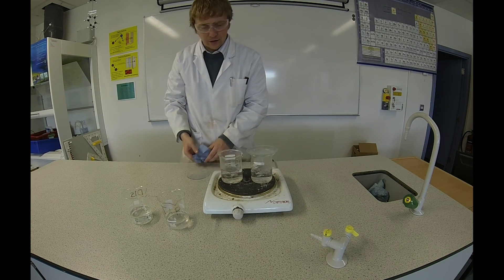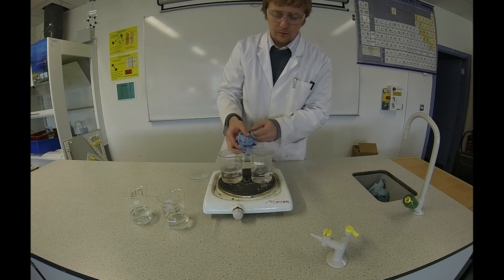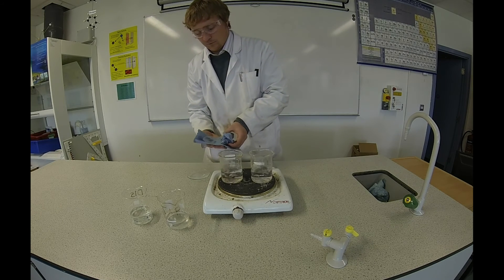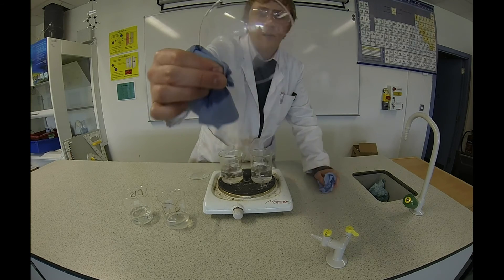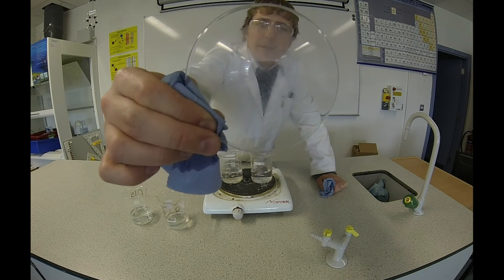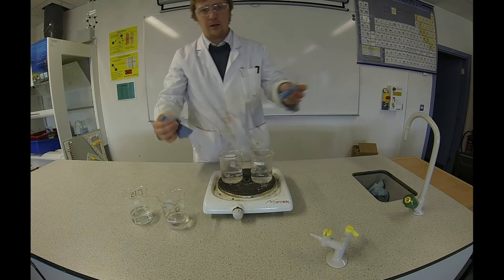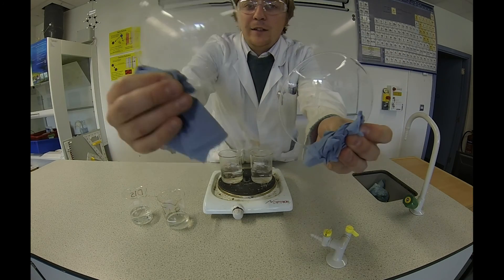Now we can compare that to our tap water sample. The tap water sample has left all these rings of dissolved substances on the clock glass. This shows that tap water has dissolved substances in it, whereas distilled water doesn't. Here's a shot of both — this is the distilled water, this was the tap water.